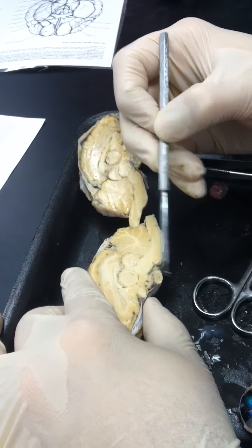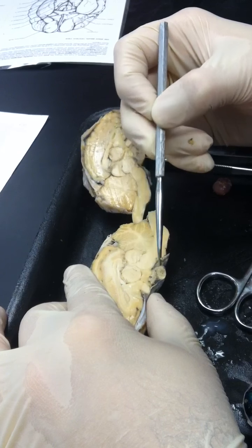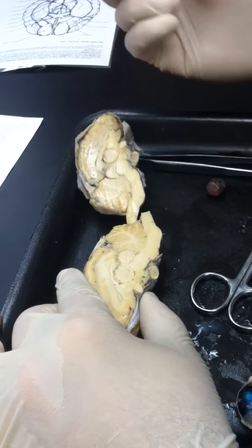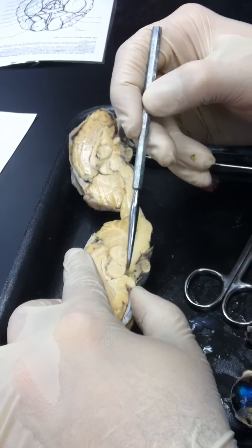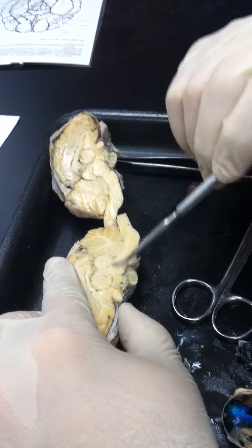Now, here is the what gland? Pituitary gland, okay? The pituitary gland's underneath. So, anything between the thalamus and the pituitary gland, so this region right here, that's the hypothalamus. Again, it's difficult because there's not the demarcation lines. It can get sort of smushed together. Now, what I've done is I've taken and exposed the demarcation lines, but they're not always there, okay?